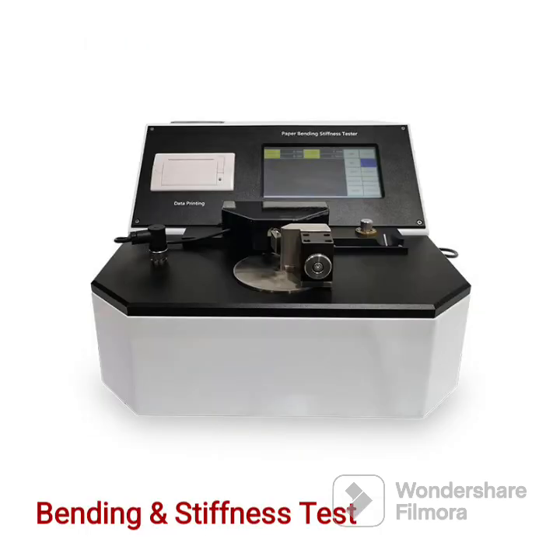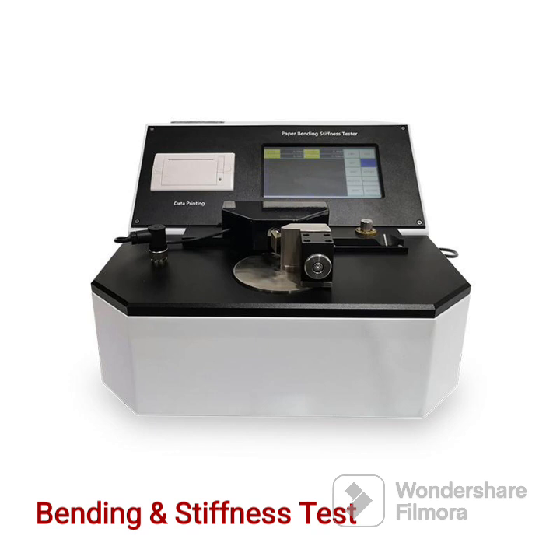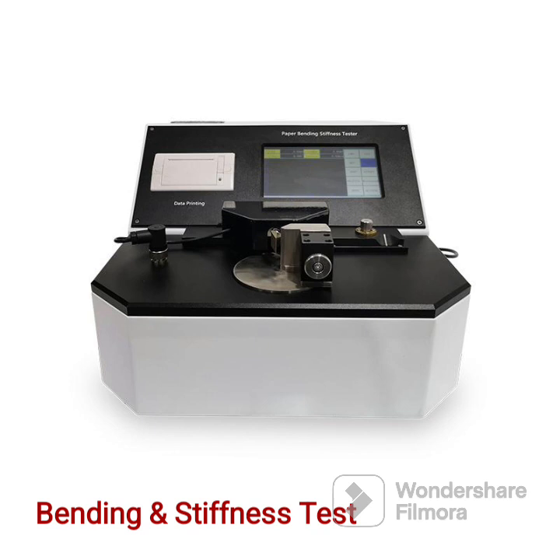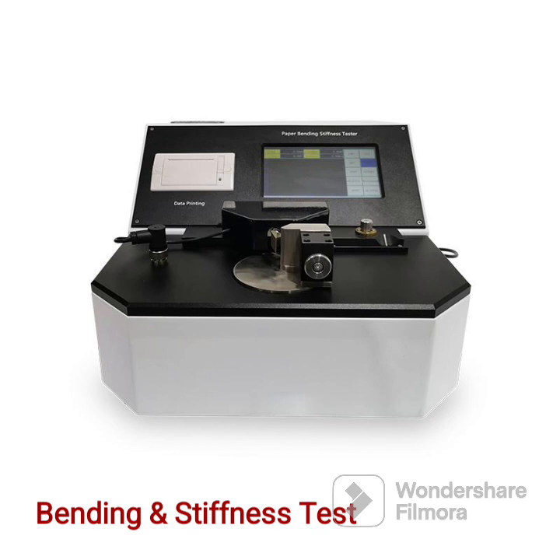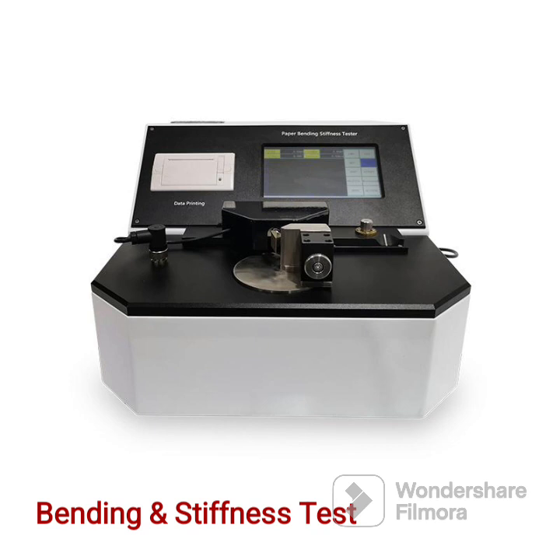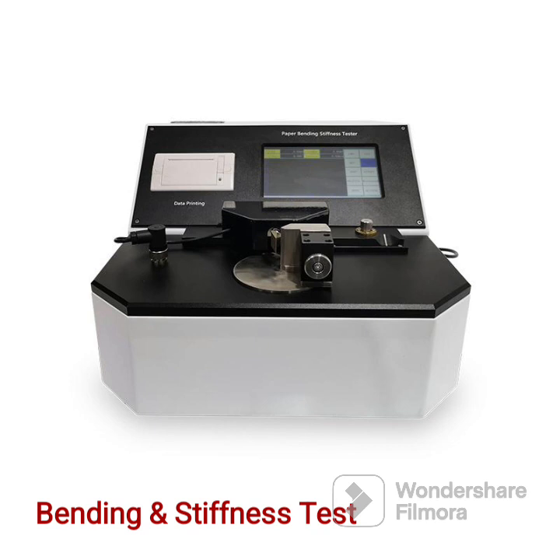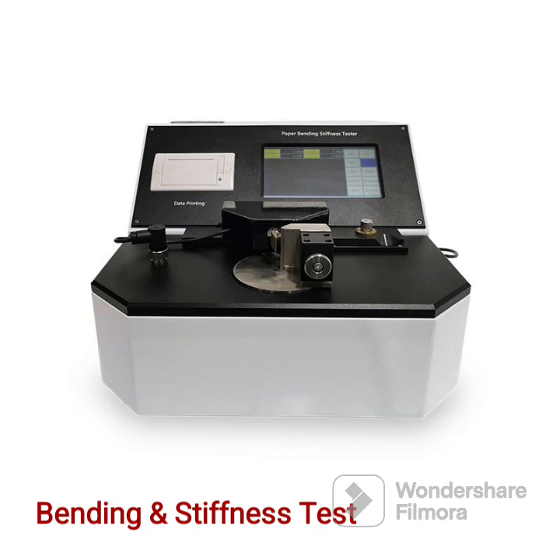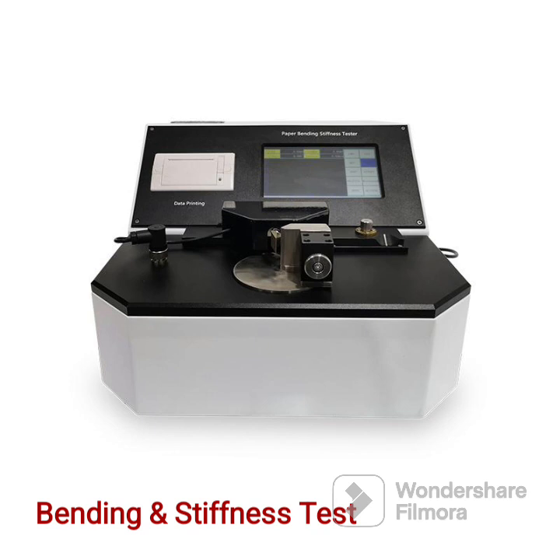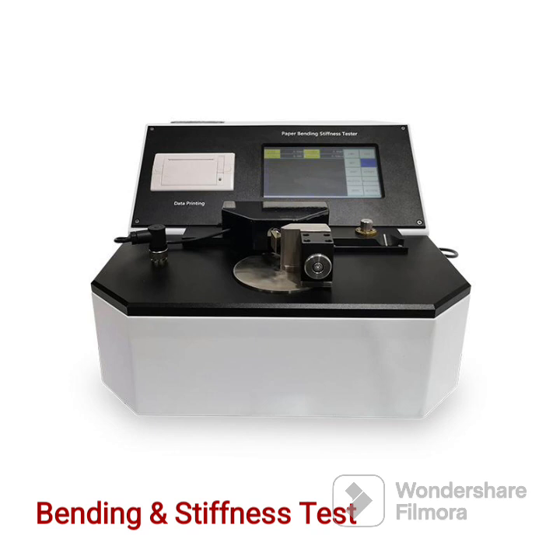Bending stiffness and resistance testing. Bending stiffness is a characteristic associated with the rigidity of a material, related to the modulus of elasticity of the material's stiffness. The bending tester was originally developed to produce a more concise, consistent measurement for the paper industry, and this property is now used in a variety of industries including personal products, paper, flexible films, packaging, and non-wovens.